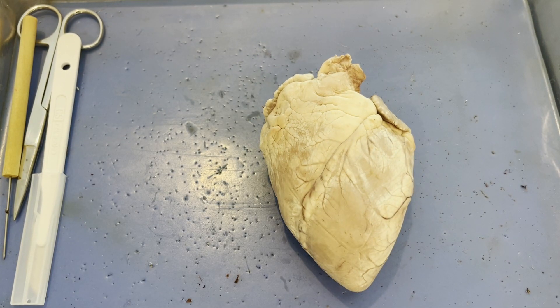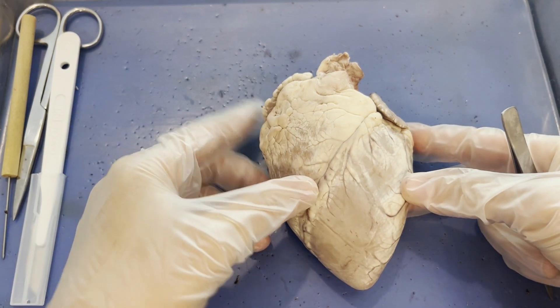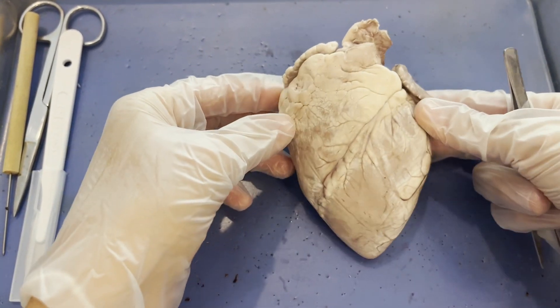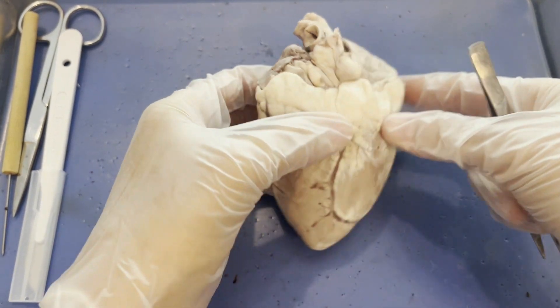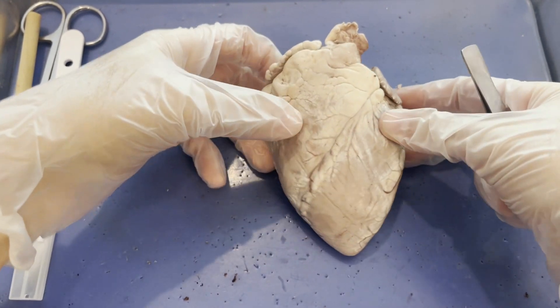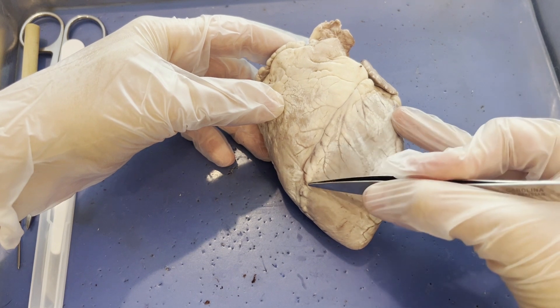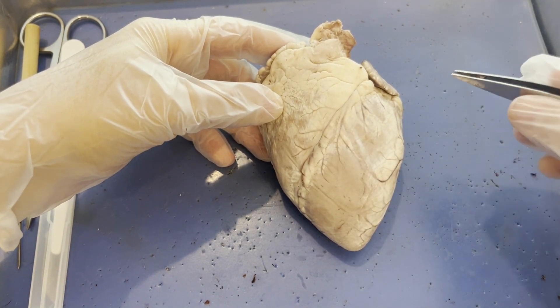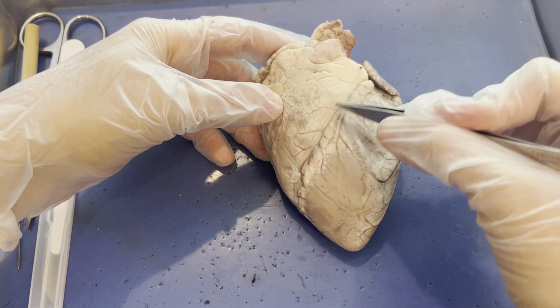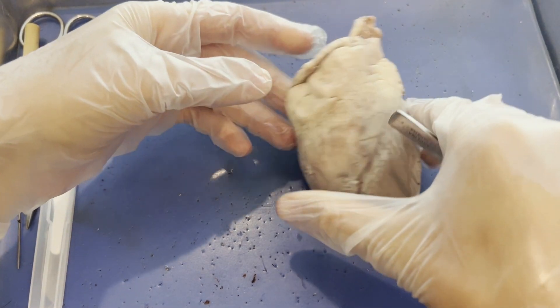Another important way to orient around this heart is knowing the difference between the anterior and posterior portions. There are three easy ways to determine which side is anterior. The first is by looking at the coronary arteries. When you're looking at the anterior side, the coronary arteries tend to cross over the heart from left to right, as you can see right here. That's one way you can identify anterior.